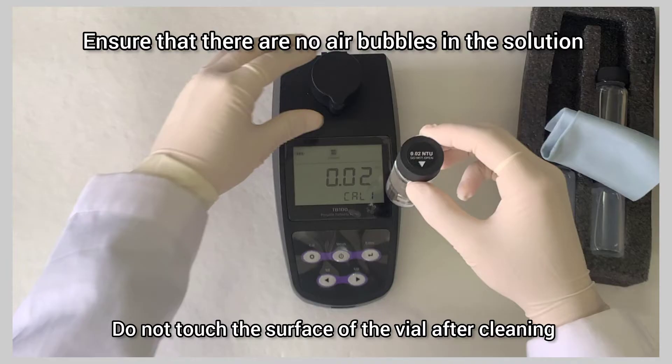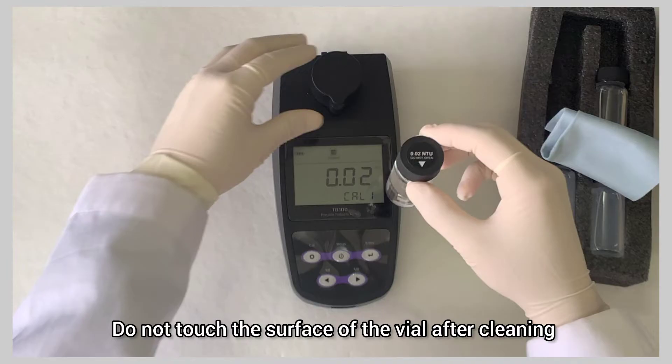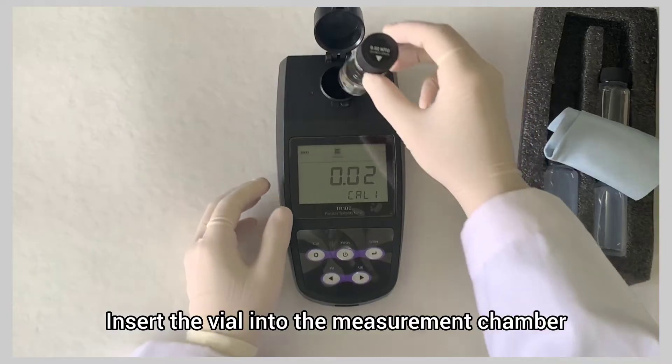Do not touch the surface of the vial after cleaning. Insert the vial into the measurement chamber.